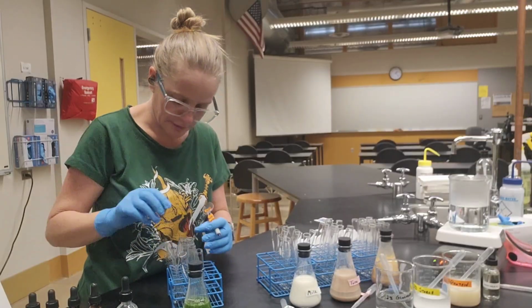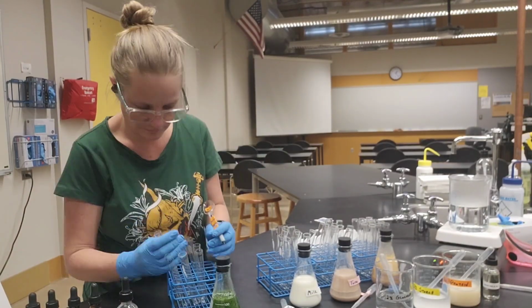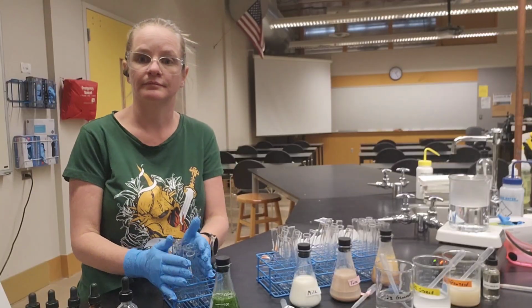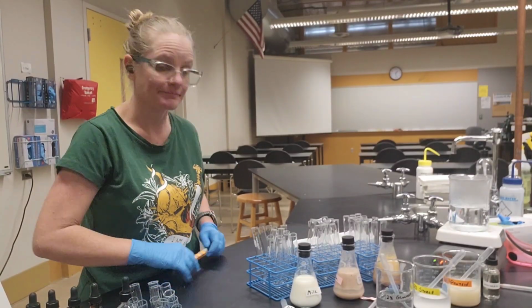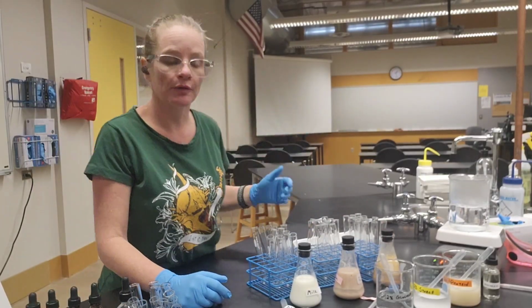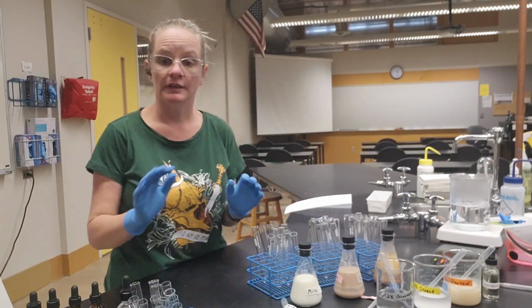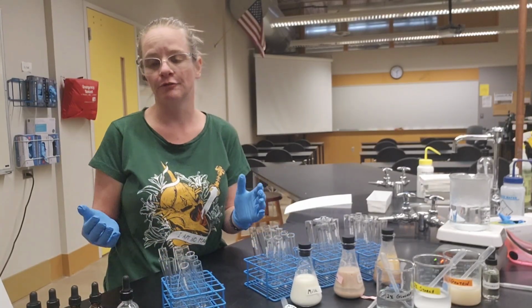Okay. Now I'm going to repeat that process. So that one's done. Oh wait, it looks the same. But everything's labeled now. Looks like my water's boiling, so I'm going to go ahead and turn that baby down to about medium. Now I'm just going to verify that I've arranged my tubes in their racks in a goof-proof way.